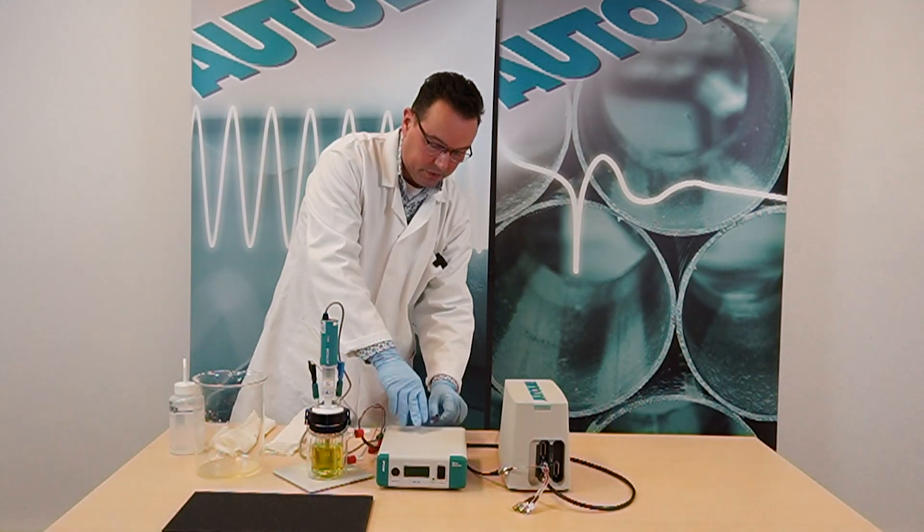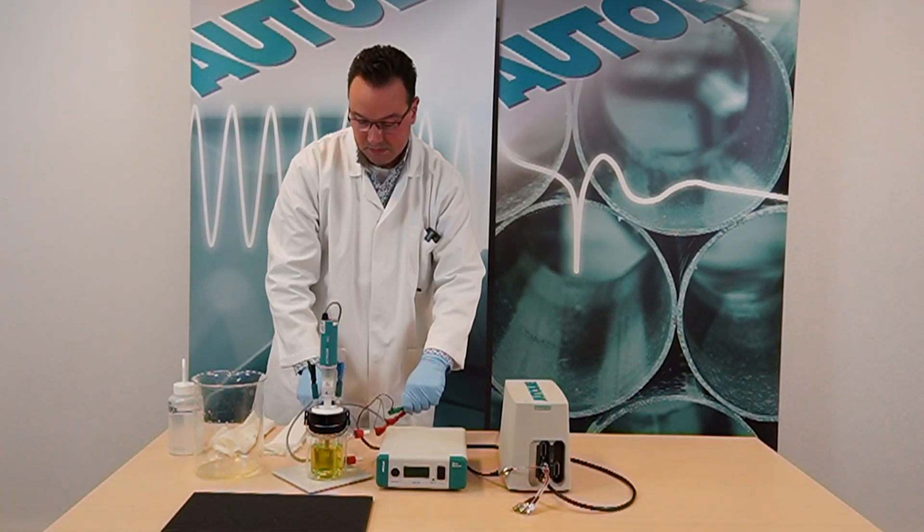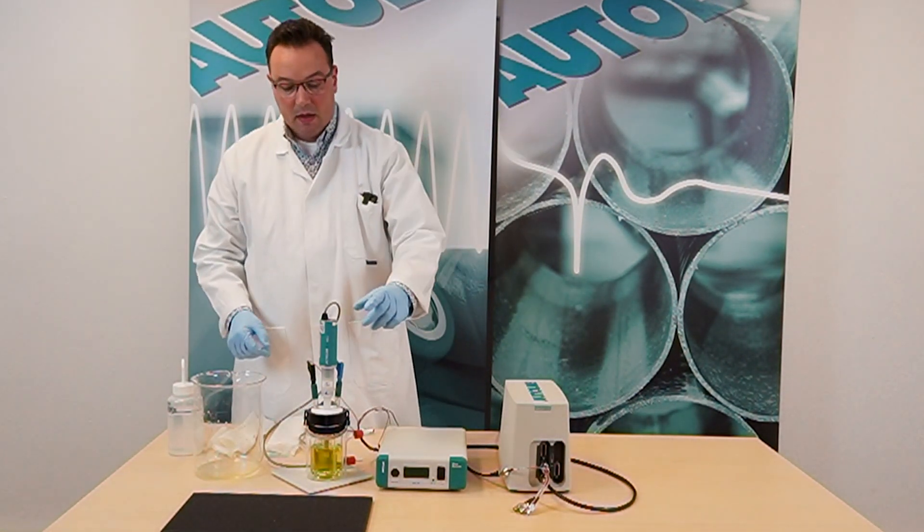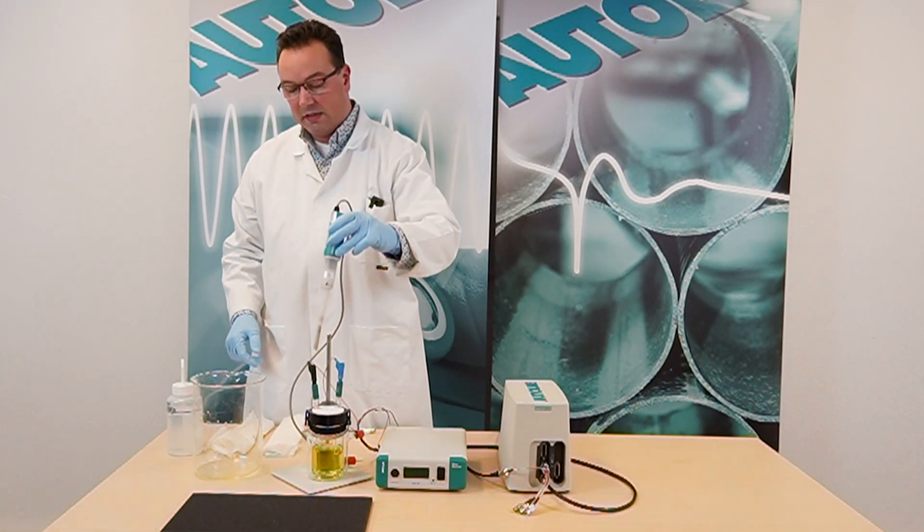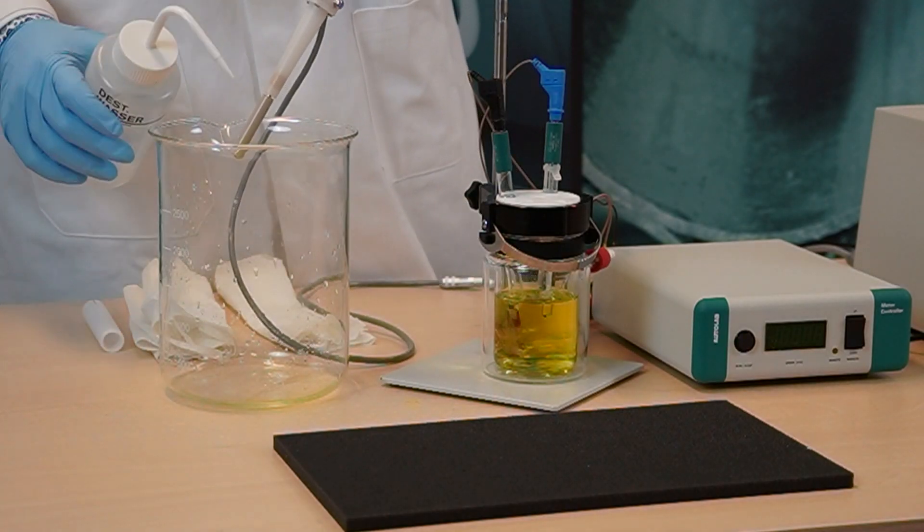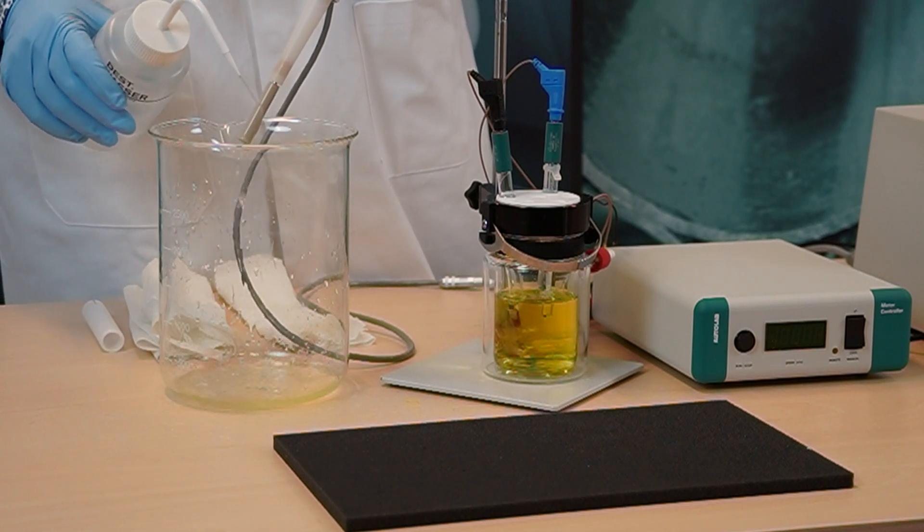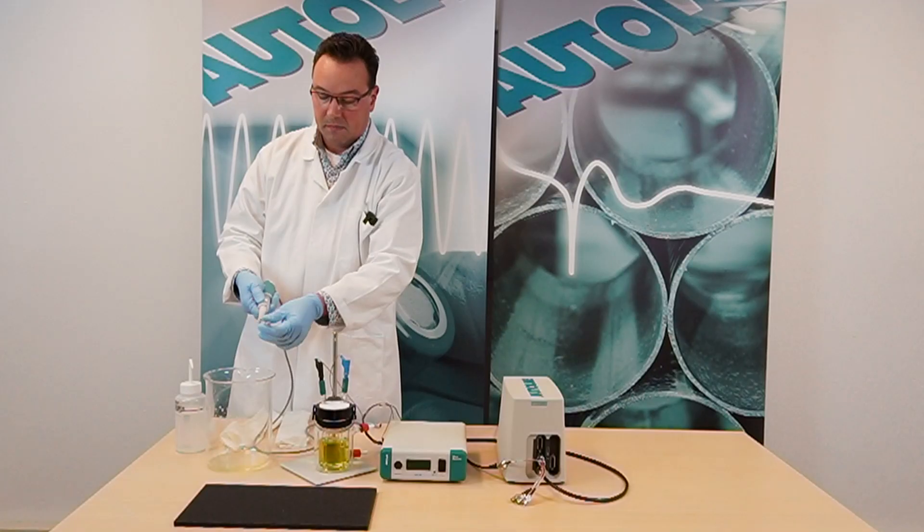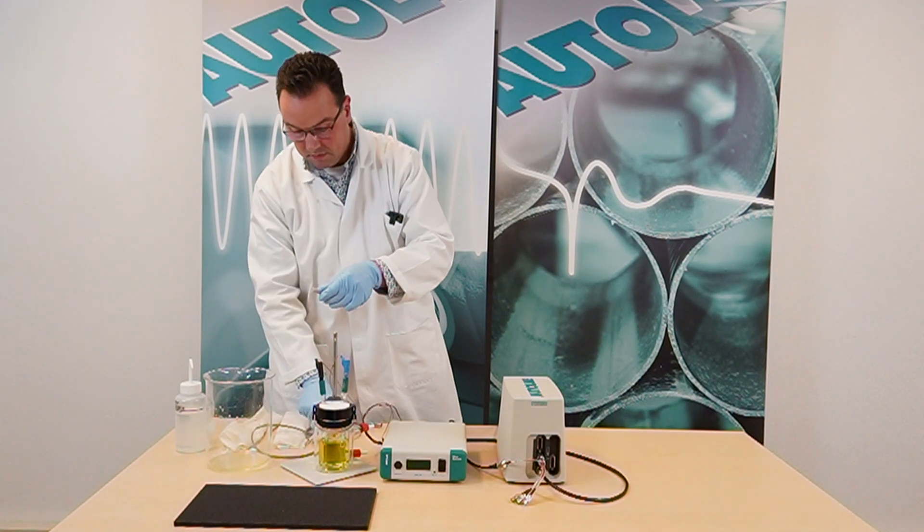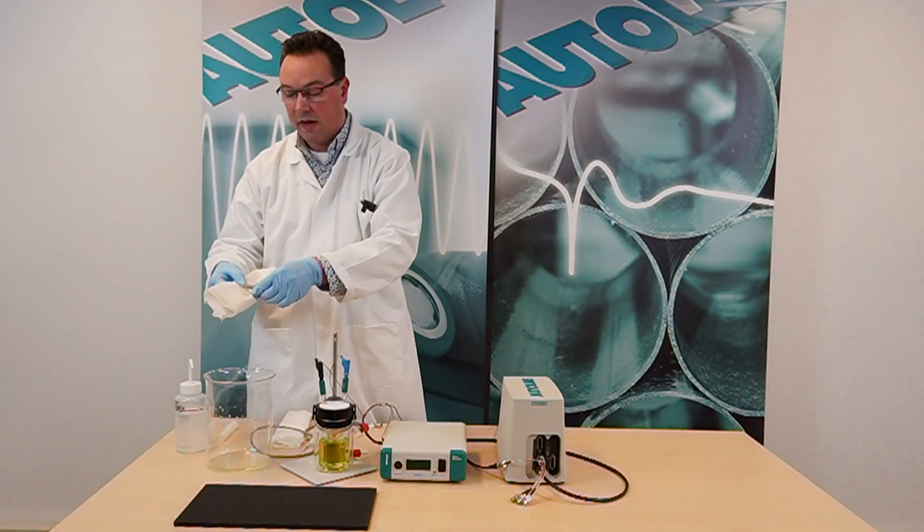Also remove the cable from the motor control unit. And then we rinse the electrode with demineralized water. Then we dry it with paper cloth.